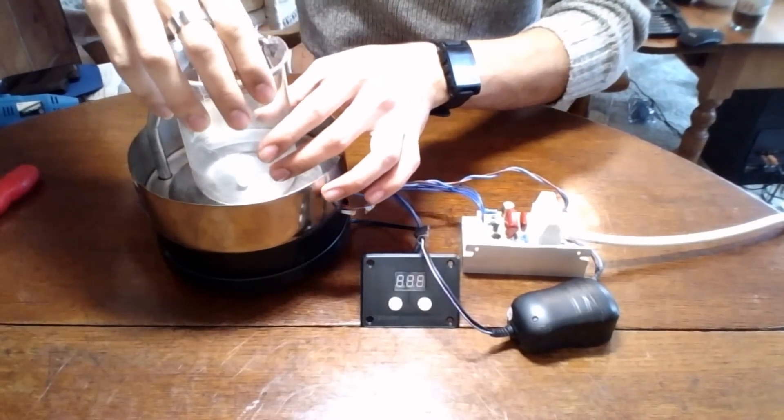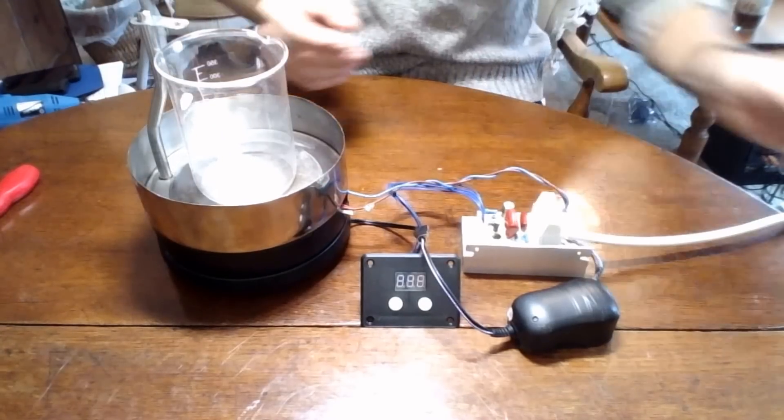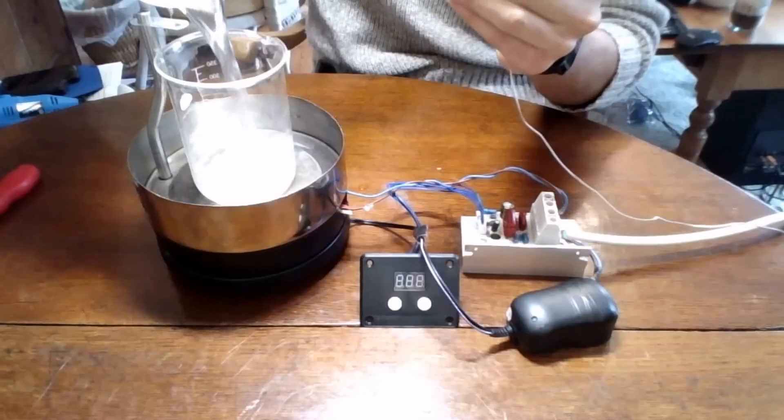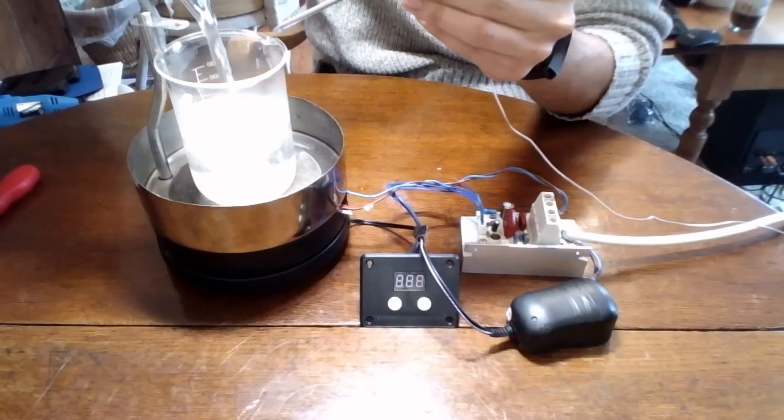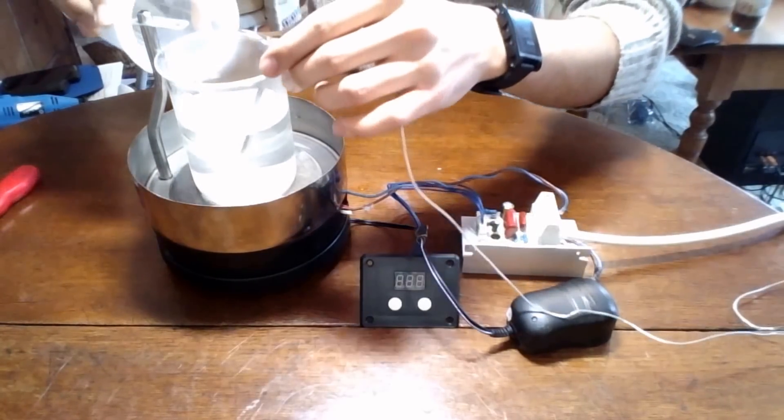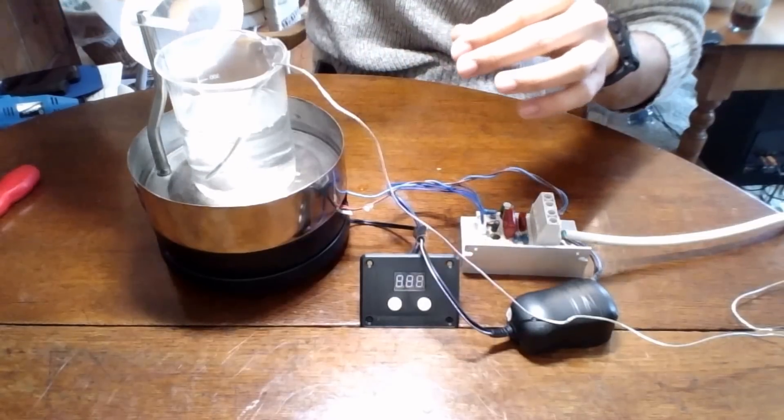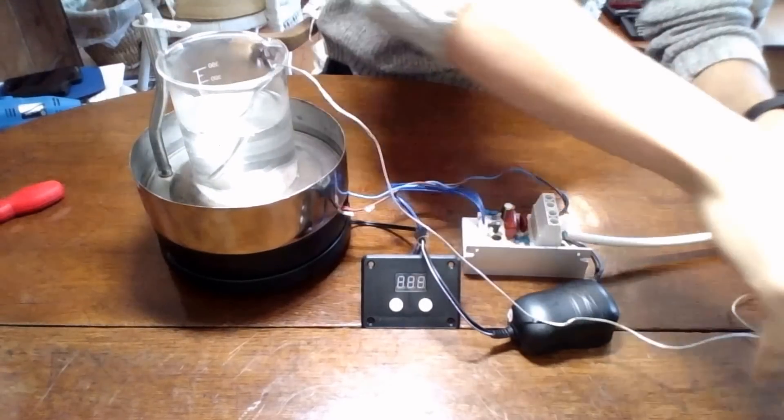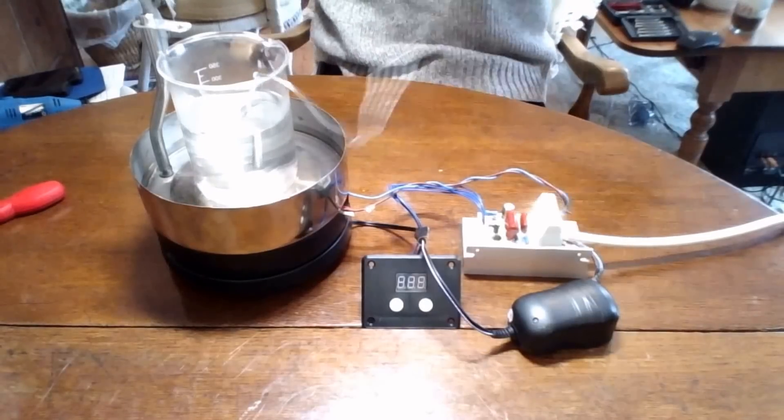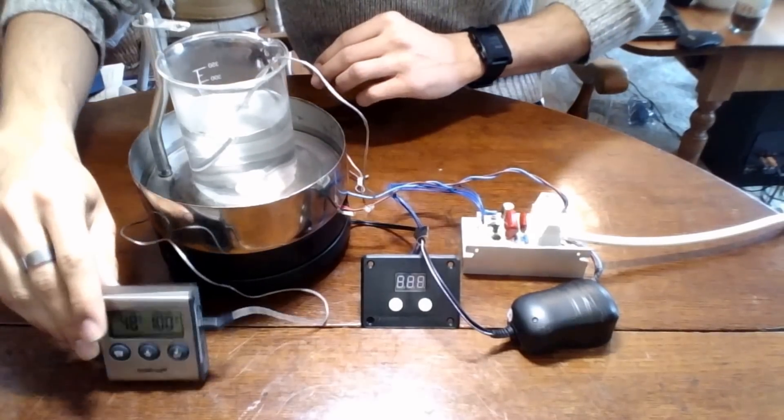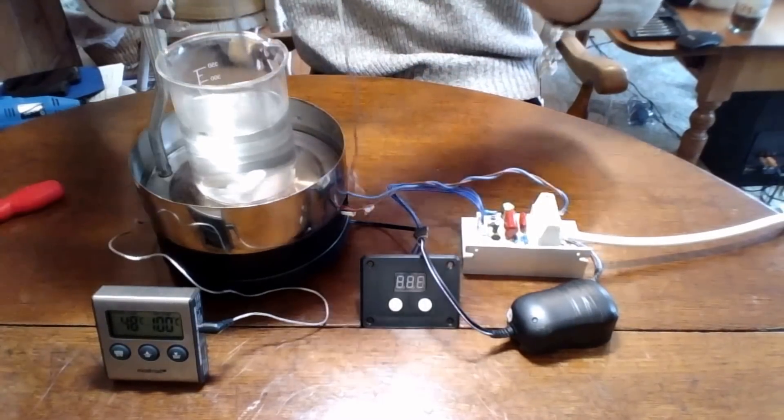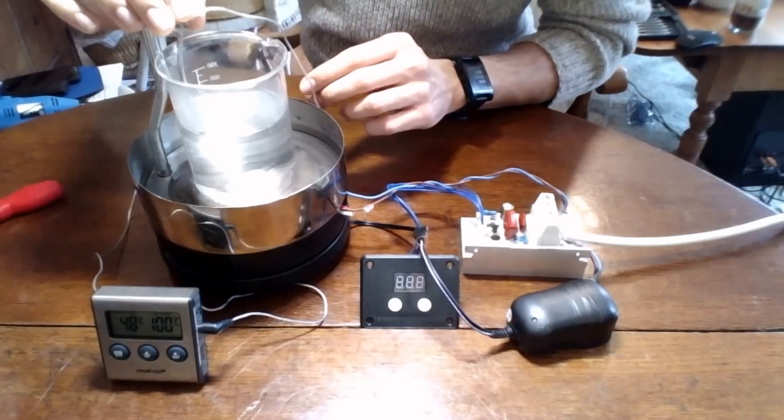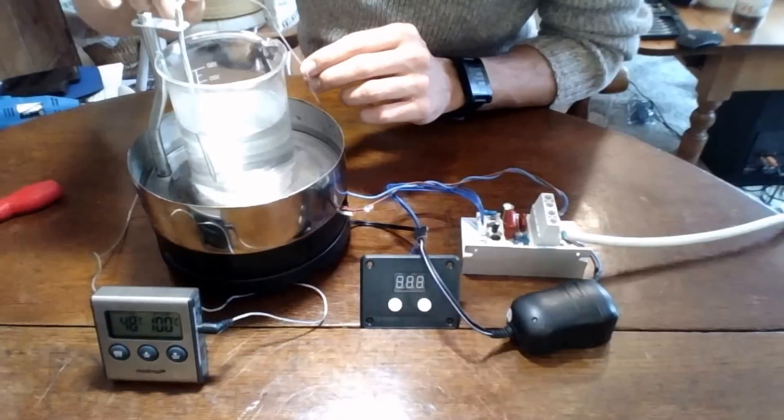So here we've got a beaker. I mean, you could use anything. You don't have to use a beaker necessarily. We'll just fill that up with some water, which is actually already heated a little bit because I've done quite a few takes, just to get it perfect for you guys.